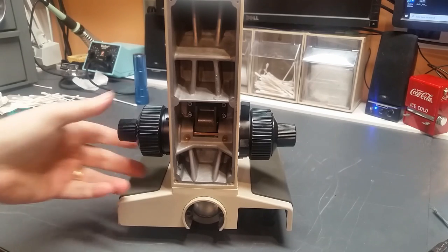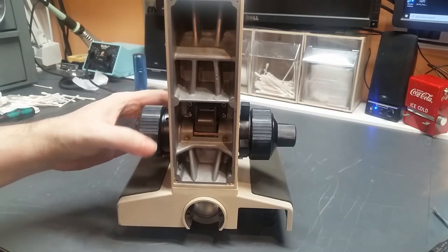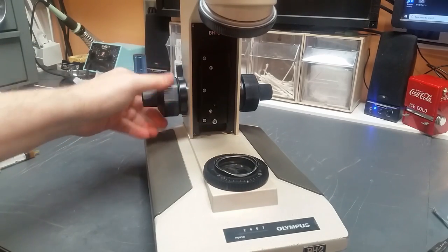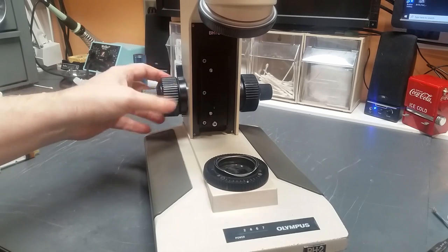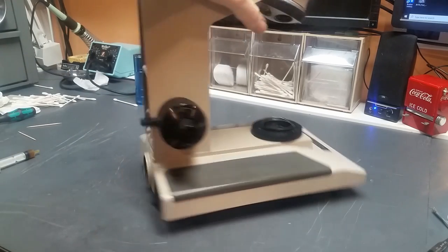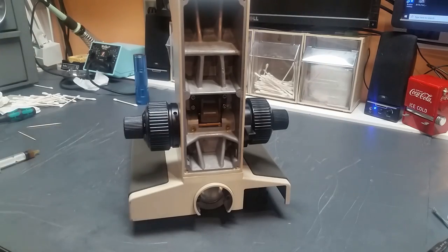Okay, the second time was a charm. This is moving now without the groan. Everything seems to be working well. If I rotate this around, you can see that the sliding focus block is actually moving like it should. And it is so much easier to turn than these knobs were when I started on this. Okay, so what that means now, put the back cover on, put the knob caps on, and just clean it up, make sure there's no grease anywhere, and this piece is done.